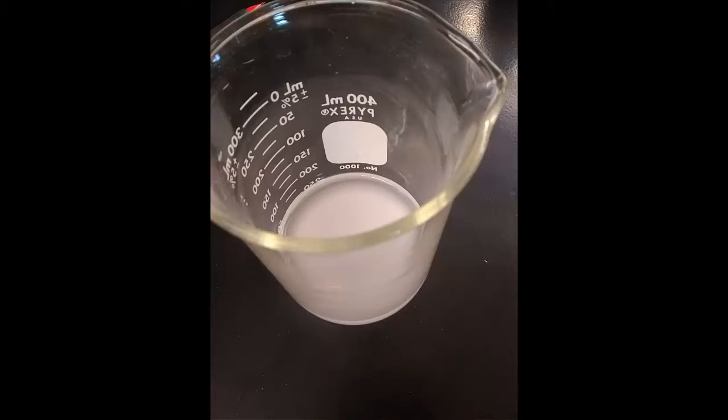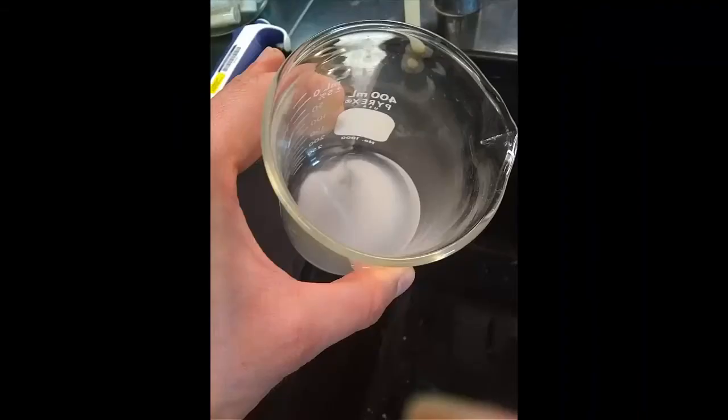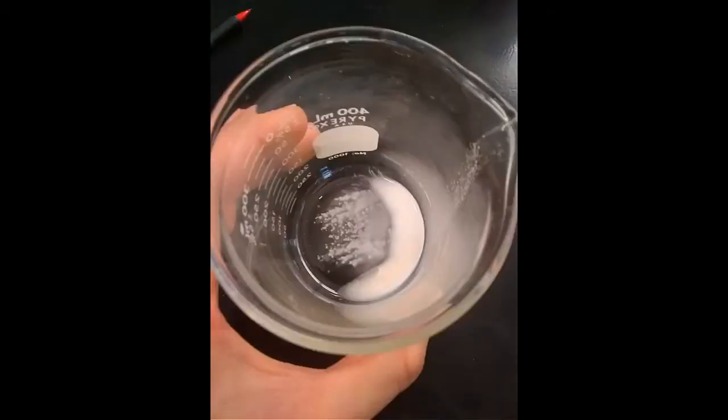This is after we added some water. Once we added a little bit more water to wash it, a lot of that starch got stirred up in the solution. Probably I should have added it a little bit slowly to the side of the glass. But still, plenty did settle, and this is us decanting the water from the top.